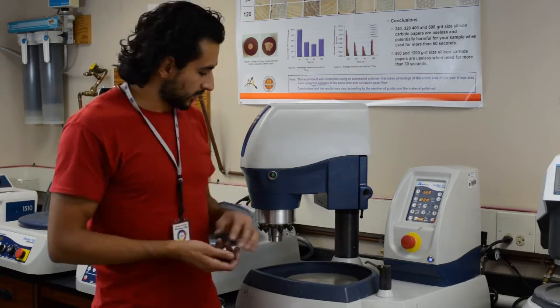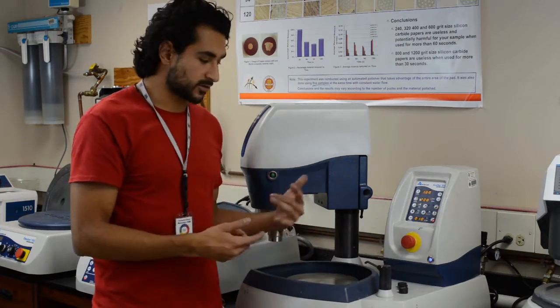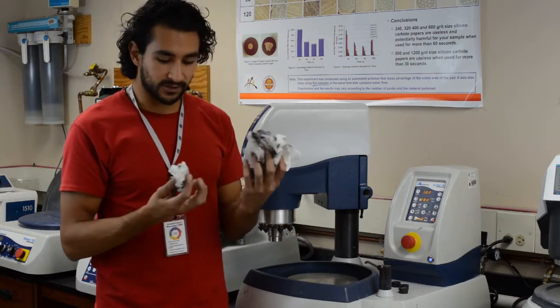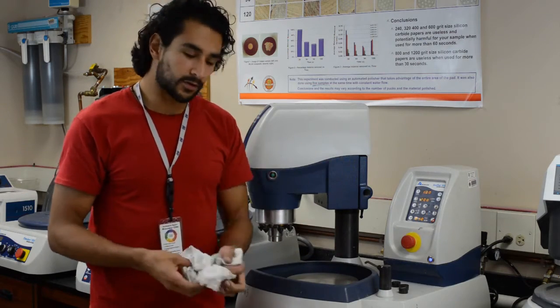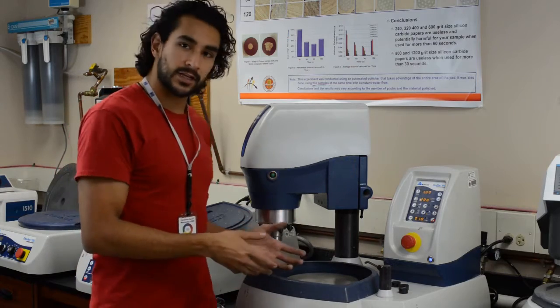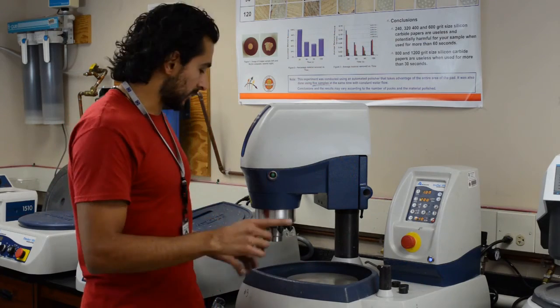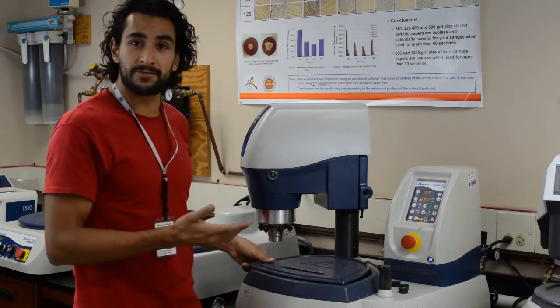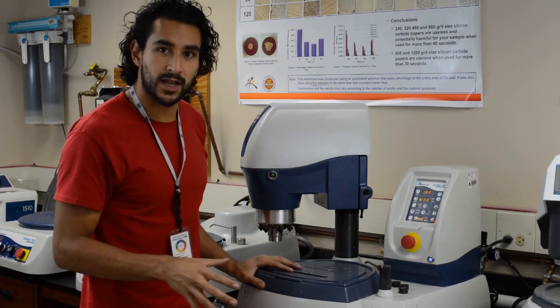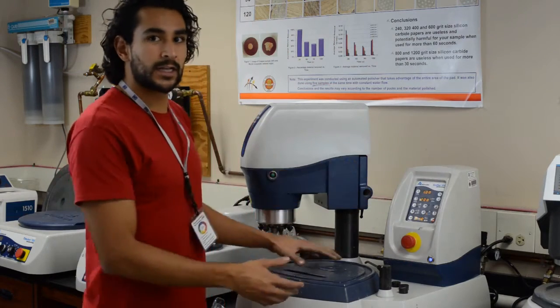Alright, I've cleaned the entire machine so I can move on to the next step. Just to show you guys how dirty this gets — you're removing a lot of this black conductive material and a lot of your sample as well, and it gets really dirty. Here are some of the paper towels I just used. Keep that in mind — make sure when you're done with your machine, or when you're jumping from step to step, make sure everything is really clean. Keep in mind that you're not the only ones using this lab — there are a lot of people using this equipment — so make sure you clean it after you're done.